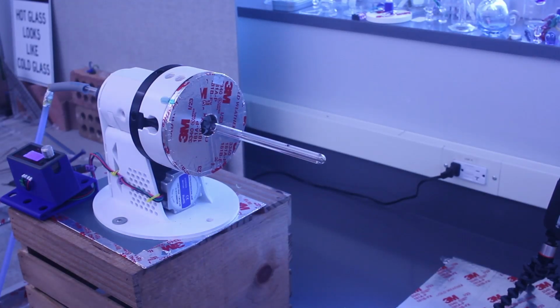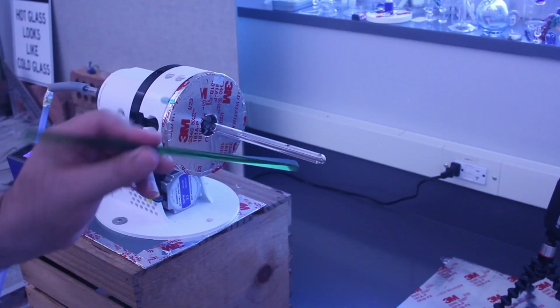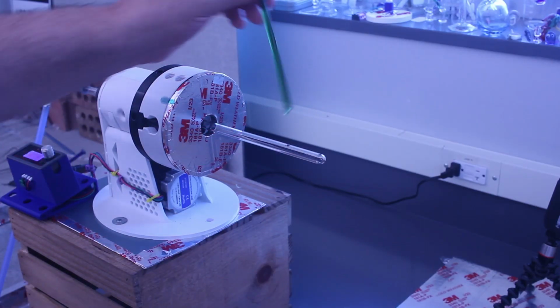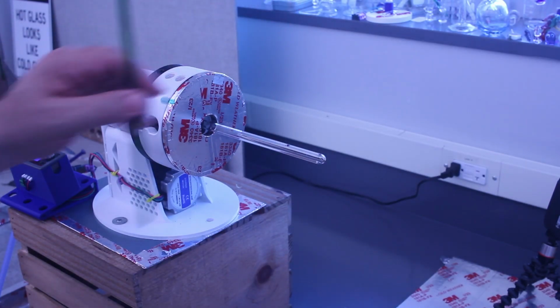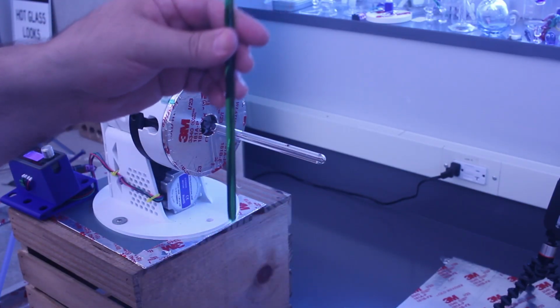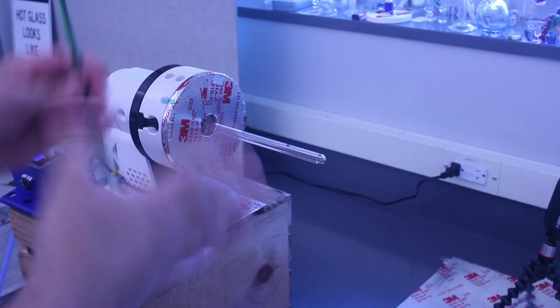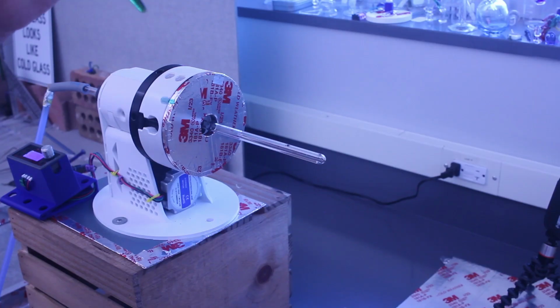I'm going to use the lathe to demonstrate a technique of sealing solid glass rod to tubing. So the tubing, of course, is hollow. When you get them up to temperature and attach them, you blow into the tubing to kind of reform the shape of the tubing and help make the seal more uniform.